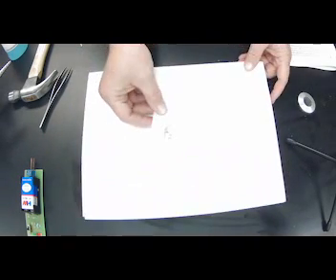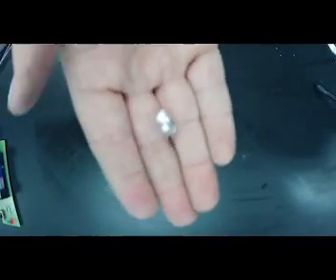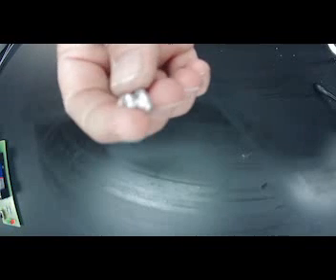And so here is aluminum. It's kind of hard to see, huh? Okay, so there's aluminum. I'm going to bring you guys down a little bit farther just so that you guys there in virtual world can see what I'm looking at, okay? All right, so this is aluminum. I'm going to hold it up here to the camera. This is aluminum. As you can see, it's a solid, but I want you to notice what color it is.